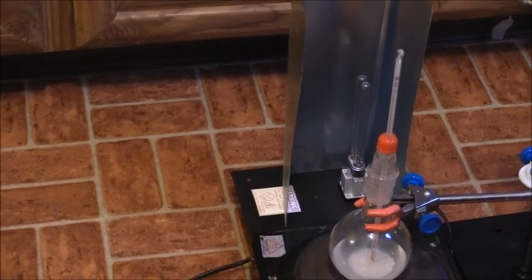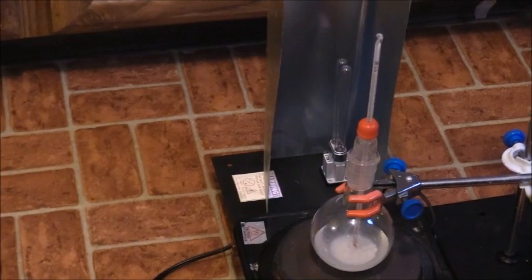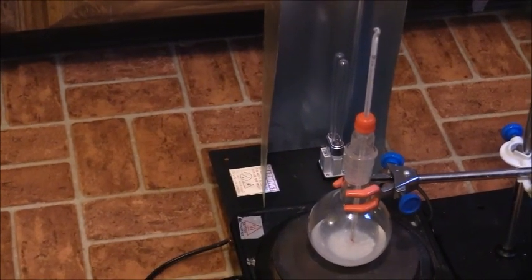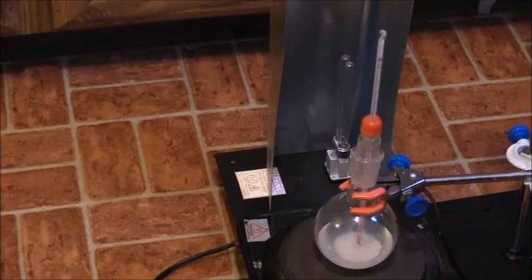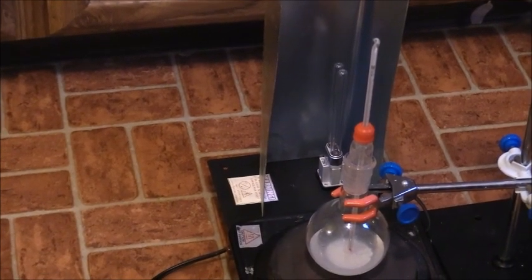And I've decided that I'm going to heat this experimental mixture to 150 Celsius for 48 hours. And so that's the experiment that I'm going to do. Stay tuned. I will move this apparatus outside and then I will start the experiment.